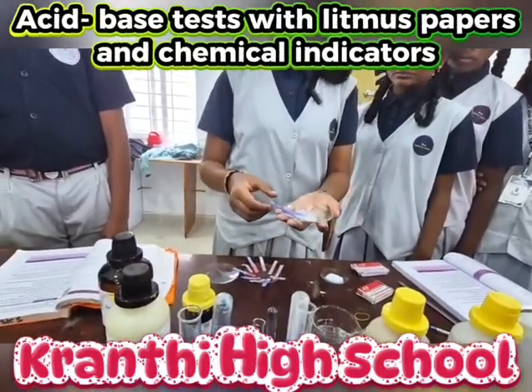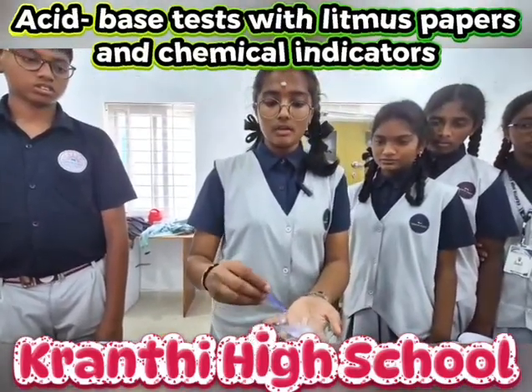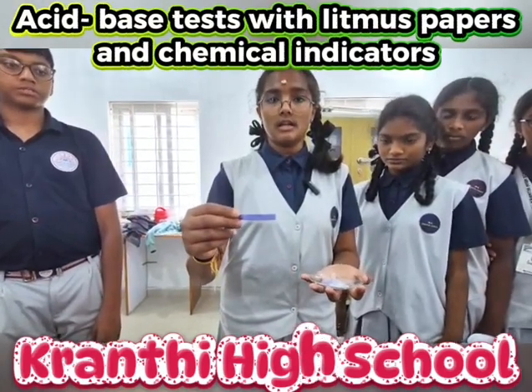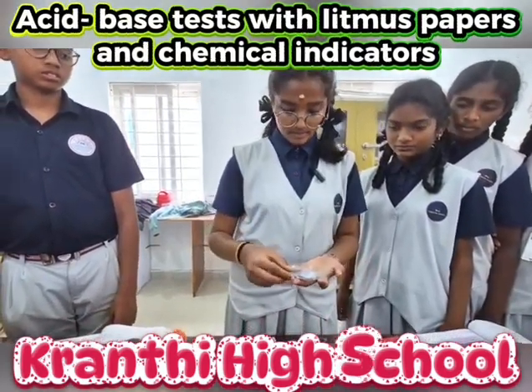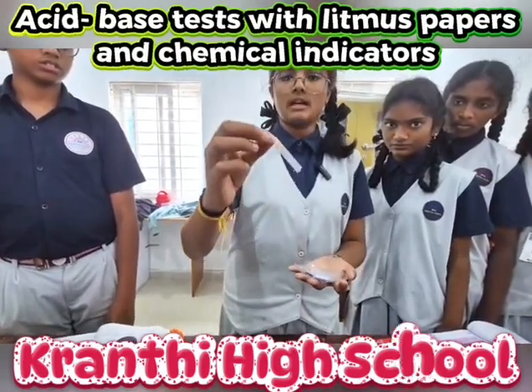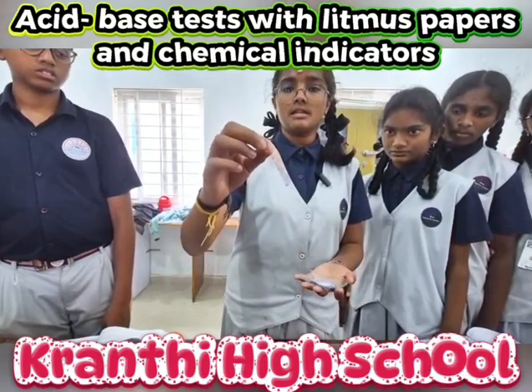Now this is the diluted solution of magnesium hydroxide. The blue litmus paper did not change its color because it is a base. The red litmus paper changed its color into blue because it is a base.